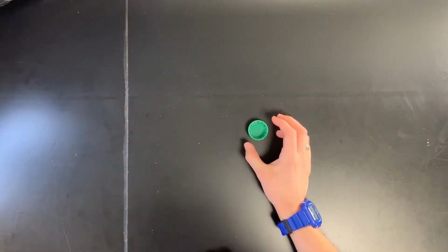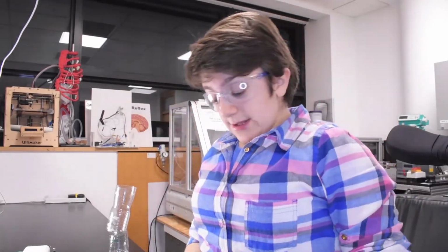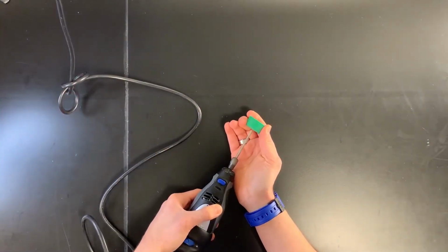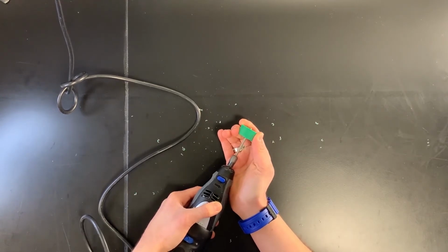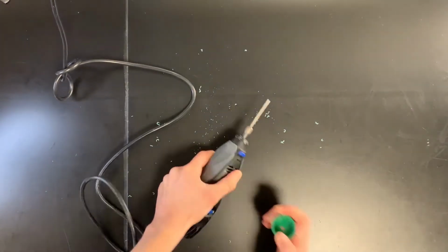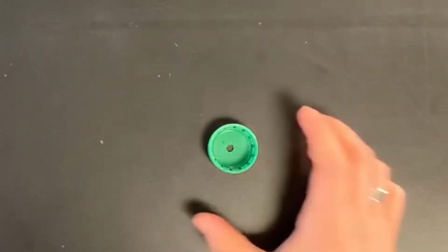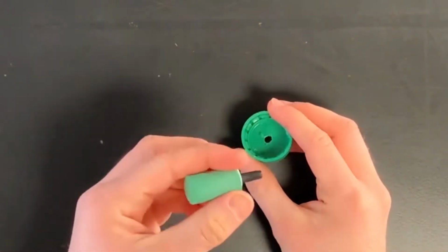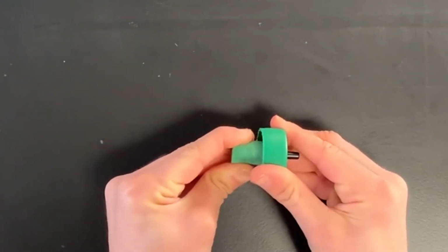So the next thing we're going to do is take one of our bottle caps from earlier and drill a hole into the center of it using our drill. Now, to do this, it's really important that we wear our safety glasses. Like that. So now that we've got the hole drilled in our bottle cap, what we're going to do is take our air stone and poke it through. Like this.